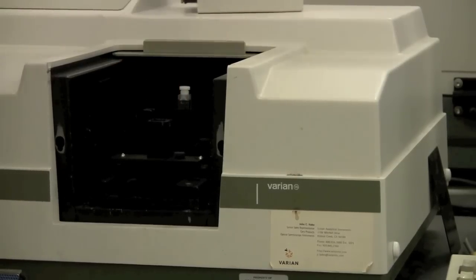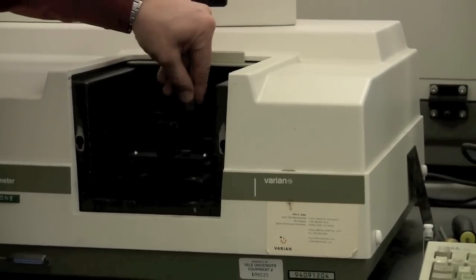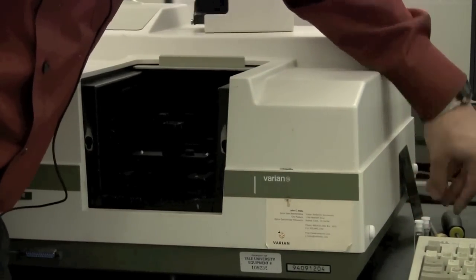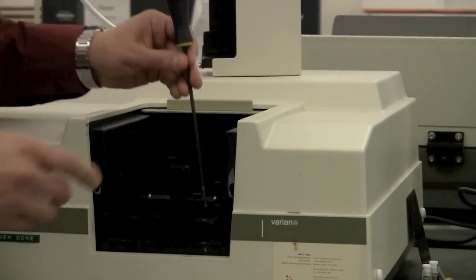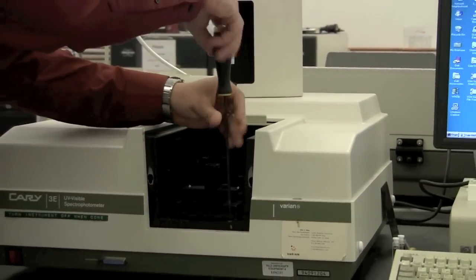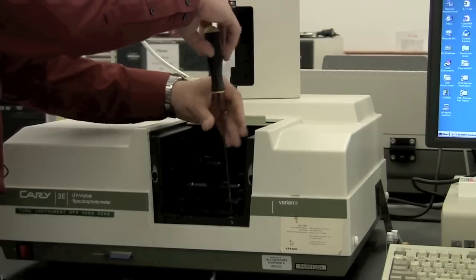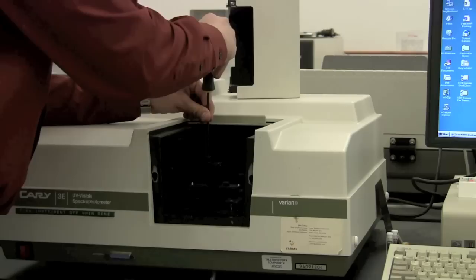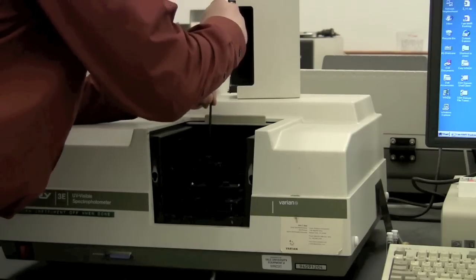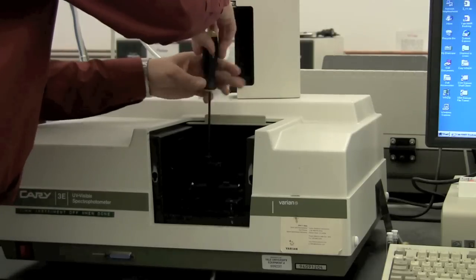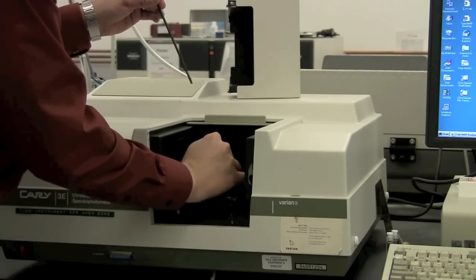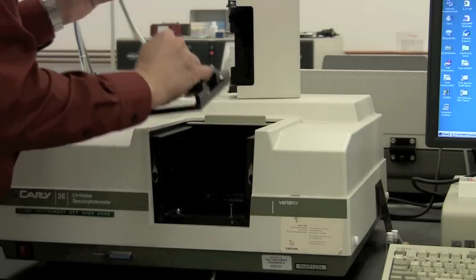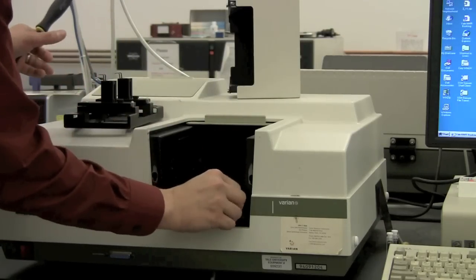If you want to do multiple samples or other than room temperature, you'll need to take out this holder. To do that, you can use this hex wrench. There's a couple of screws in here that you'll need to take out. You can either loosen them or you can take them out entirely. And then you can just lift and slide out this holder here. You can take out the screw entirely.